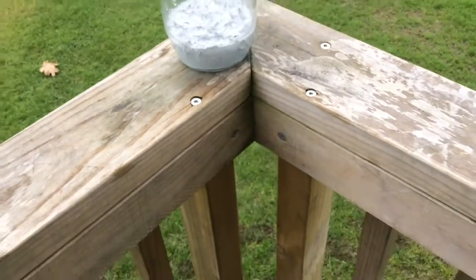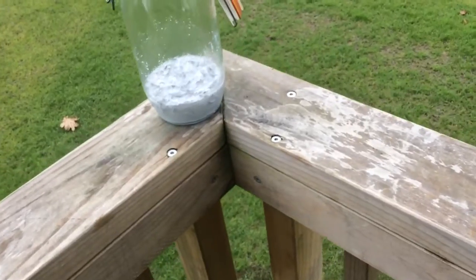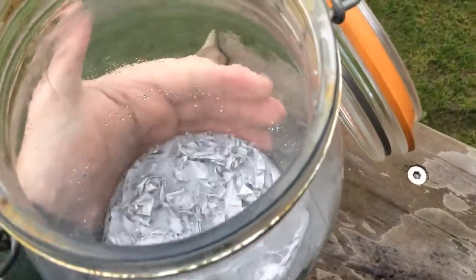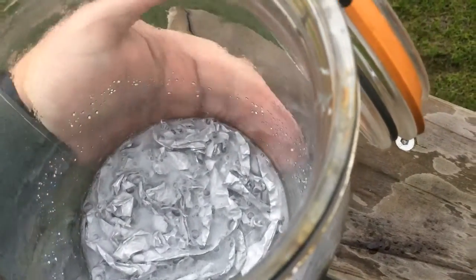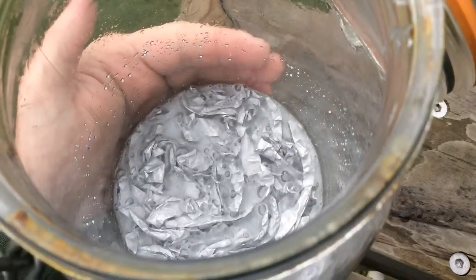It's taking quite some time this time, and I think even though I cut it into fine strips, some of the tinfoil was folded in half, so the acid is having a hard time breaking down the aluminum. It's not working as fast as it normally would.